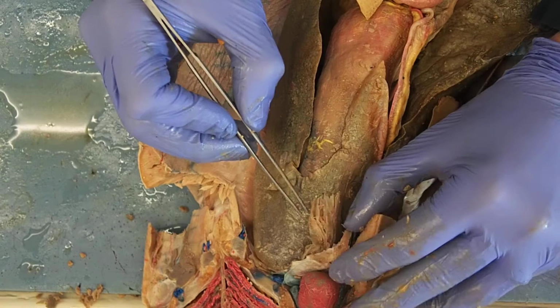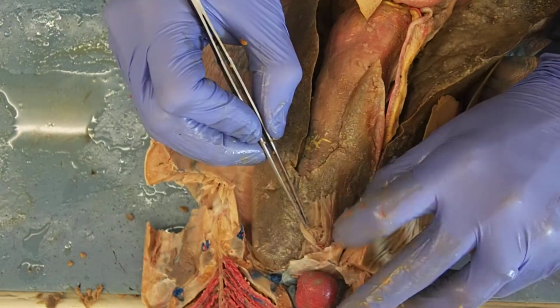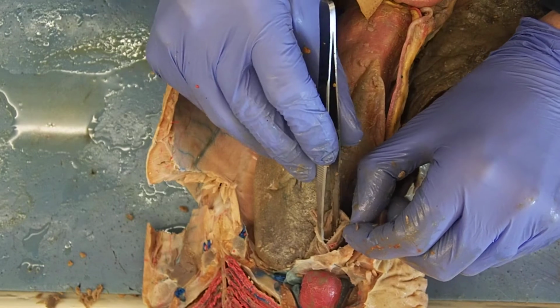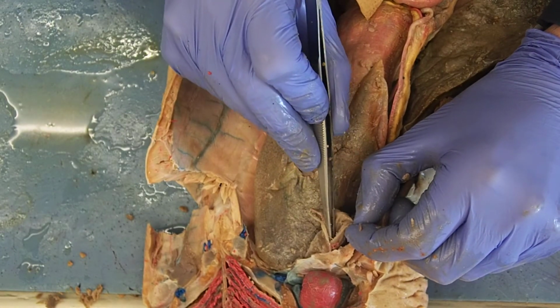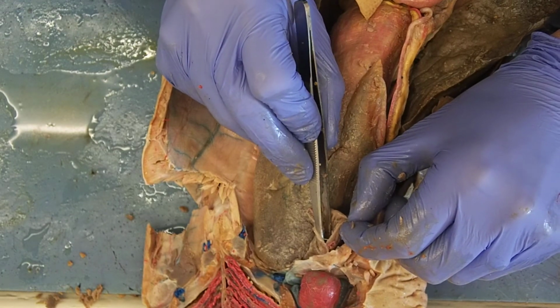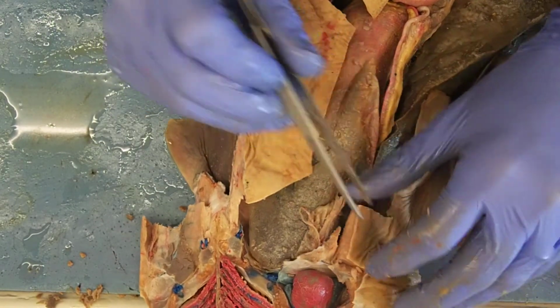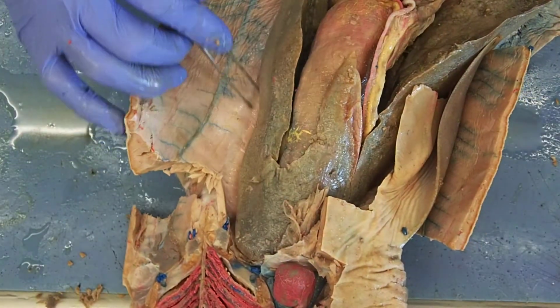And if I look within this, here's the opening. My forceps are now in the opening. My forceps have gone through the ostium tubae into the oviducts. Those oviducts split. One goes off to the shark's left, the other goes off to the shark's right. And they dive dorsal to the liver, and they run down.